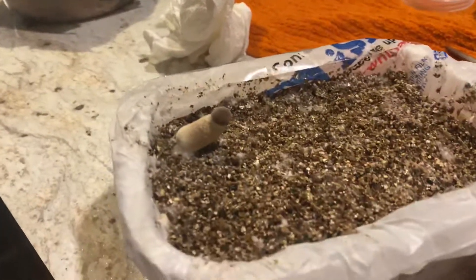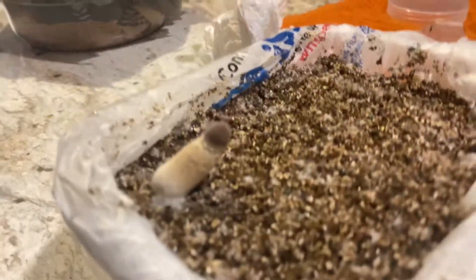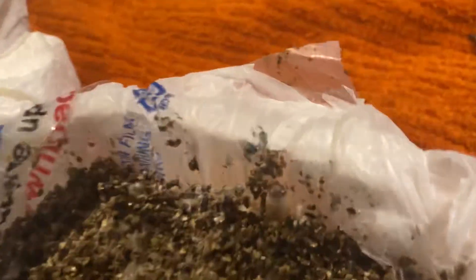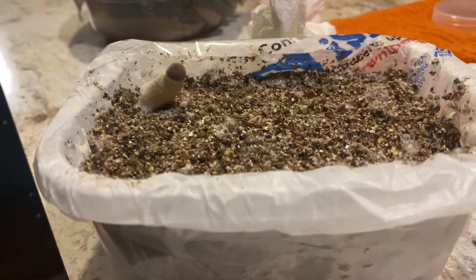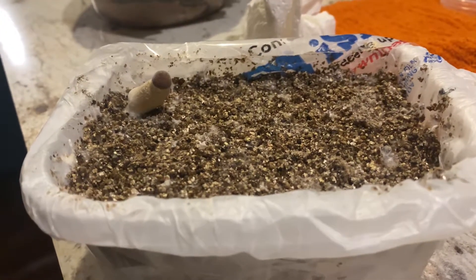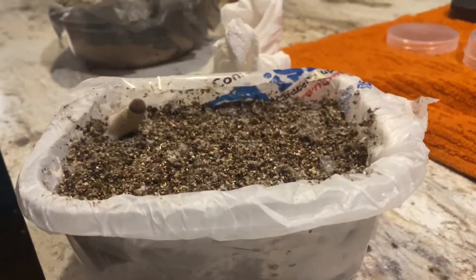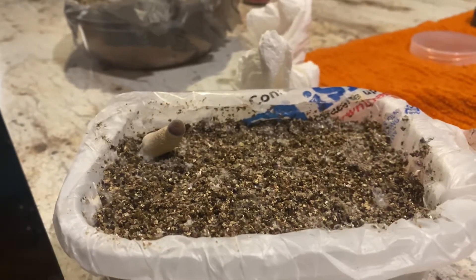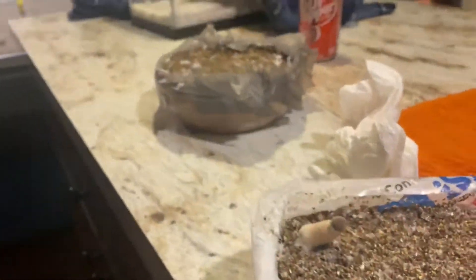In this little container it seems we're only going to get one full-size fruit body. This actually had almost a week where the perlite container it was in had fairly dehydrated perlite. I replaced it and got the relative humidity back up to close to 100 percent, and sure enough the mycelium continued to colonize and spread, so I ended up getting one fruit body.